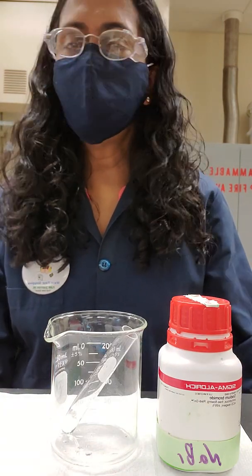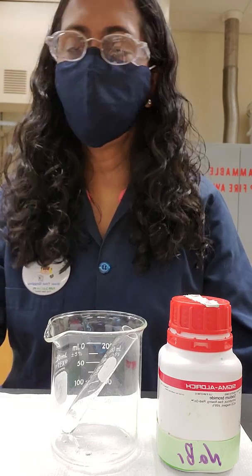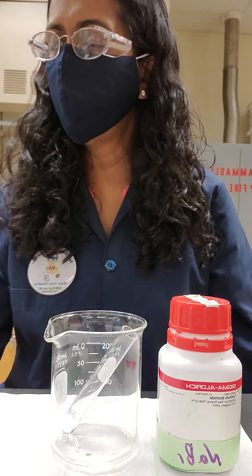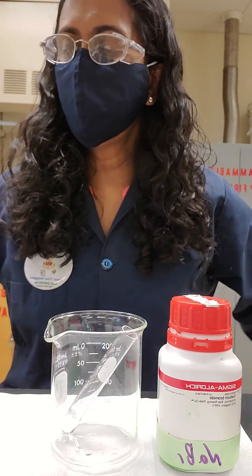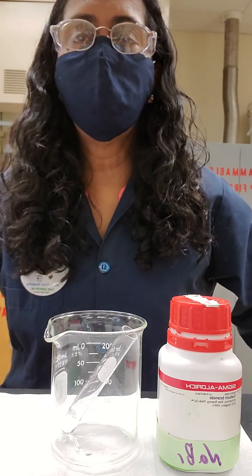We are now on our copper bromide equilibrium, that is number three in your lab menu on page 24, copper bromide and equilibrium of aqueous copper bromide.